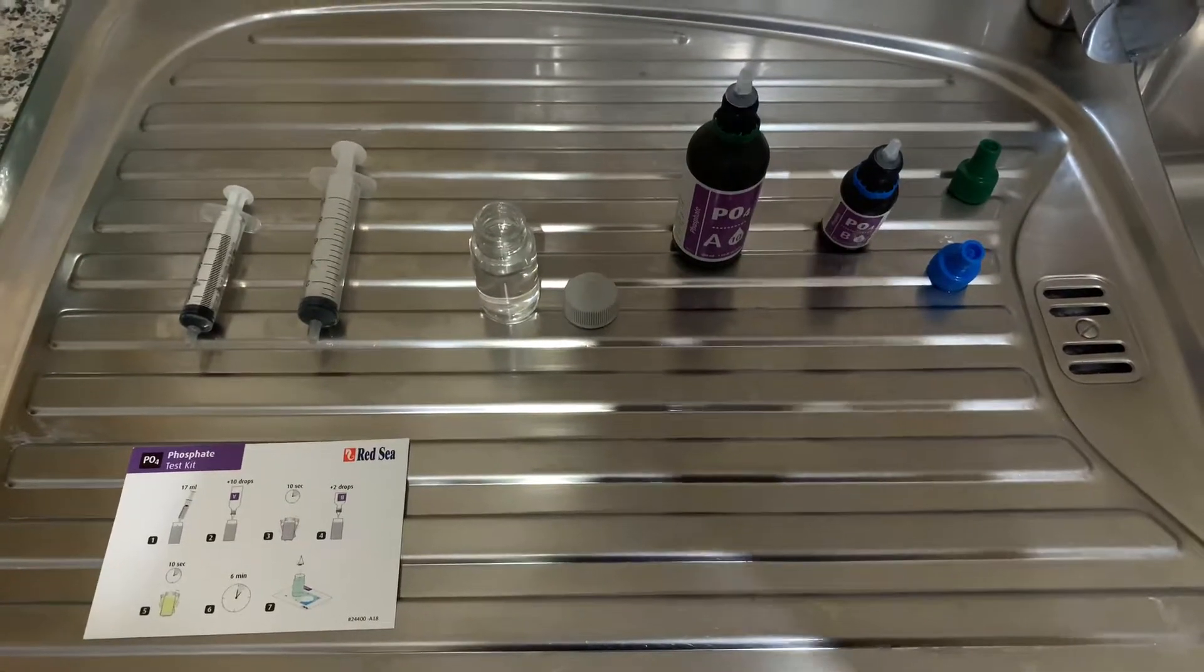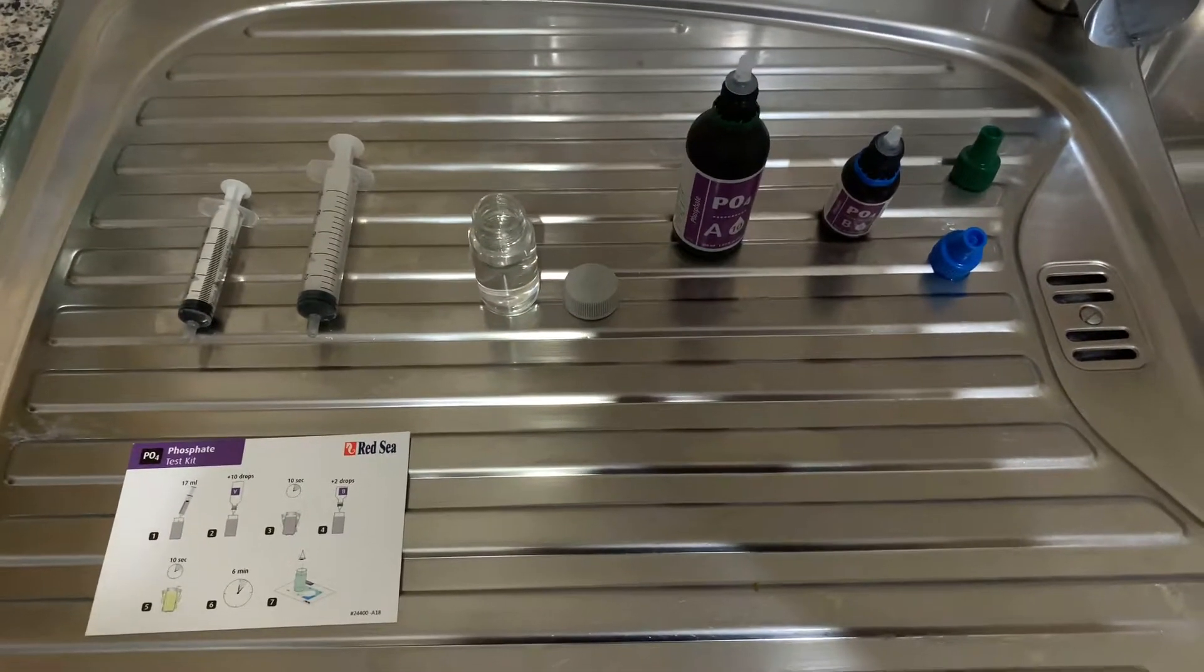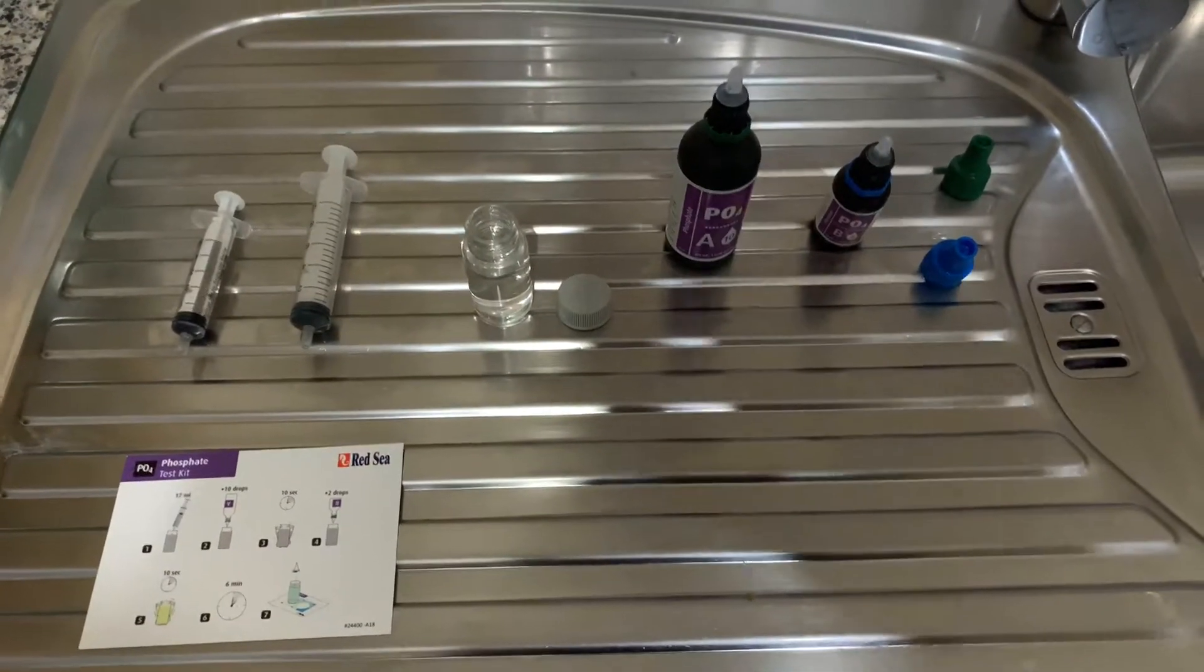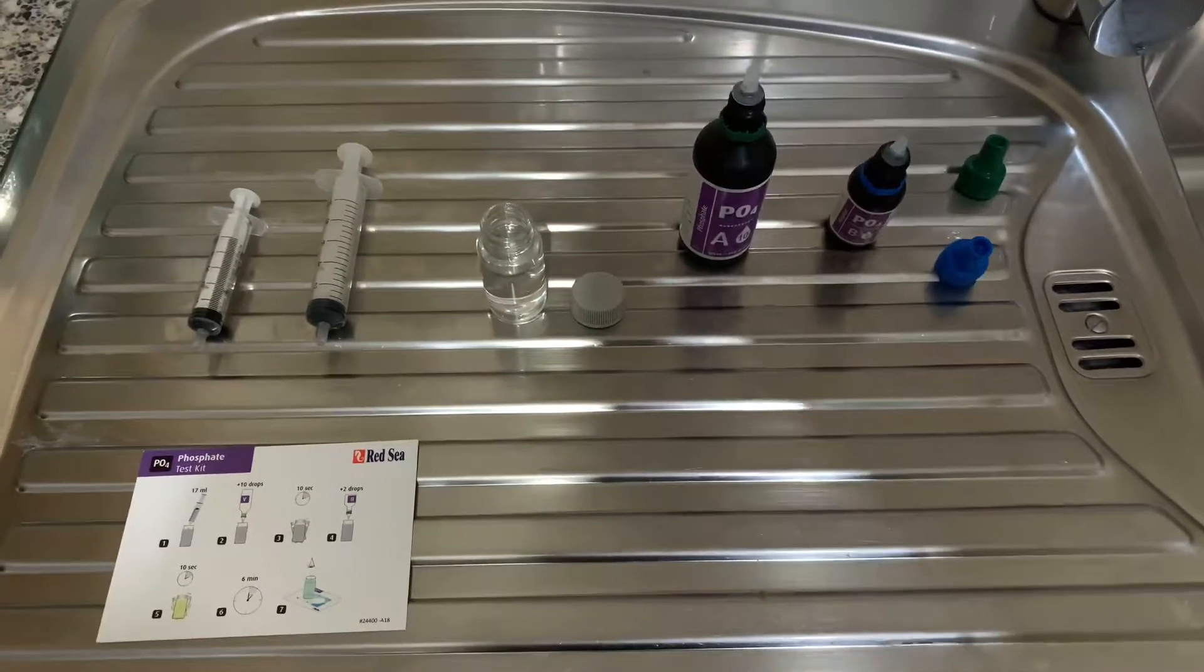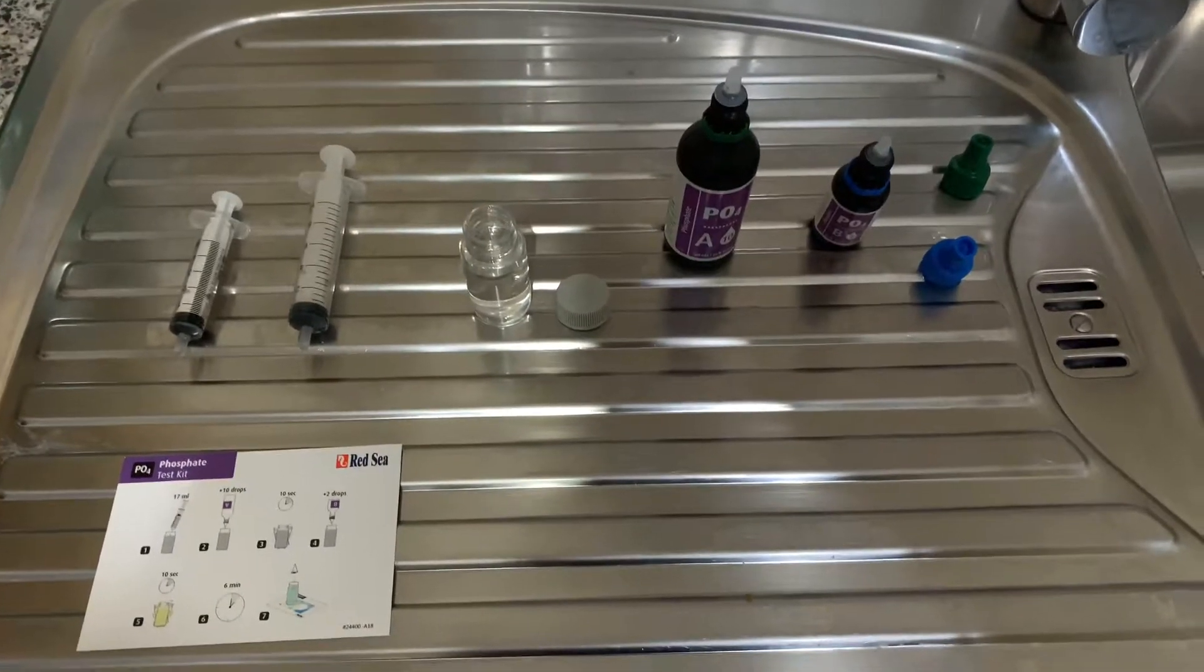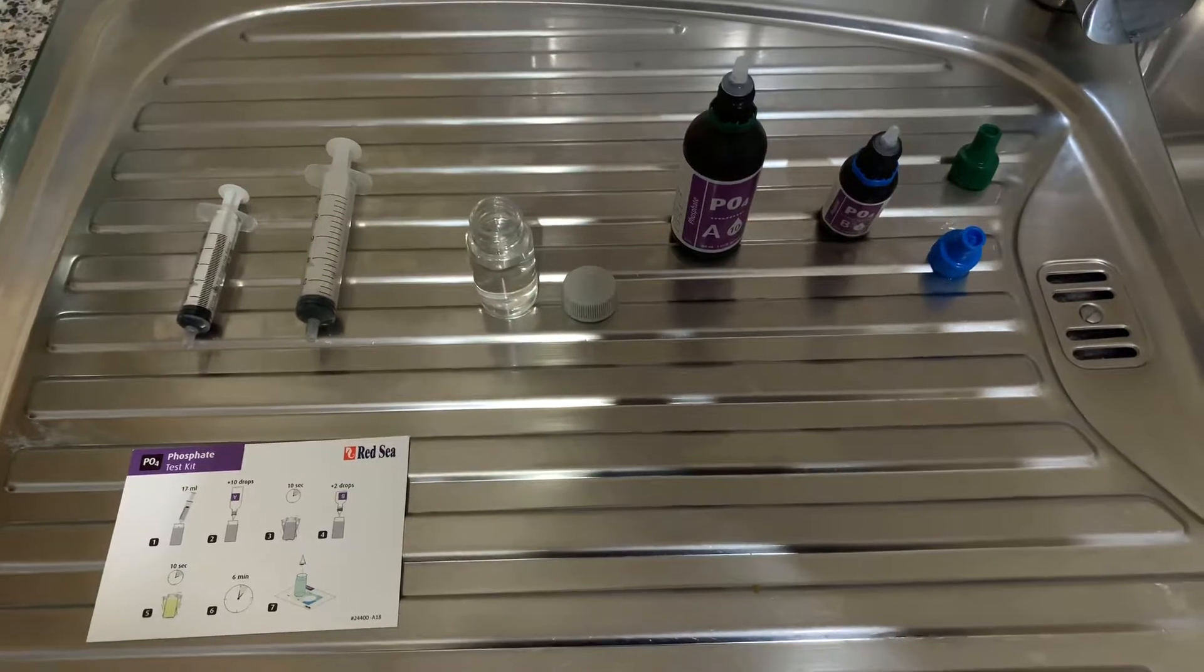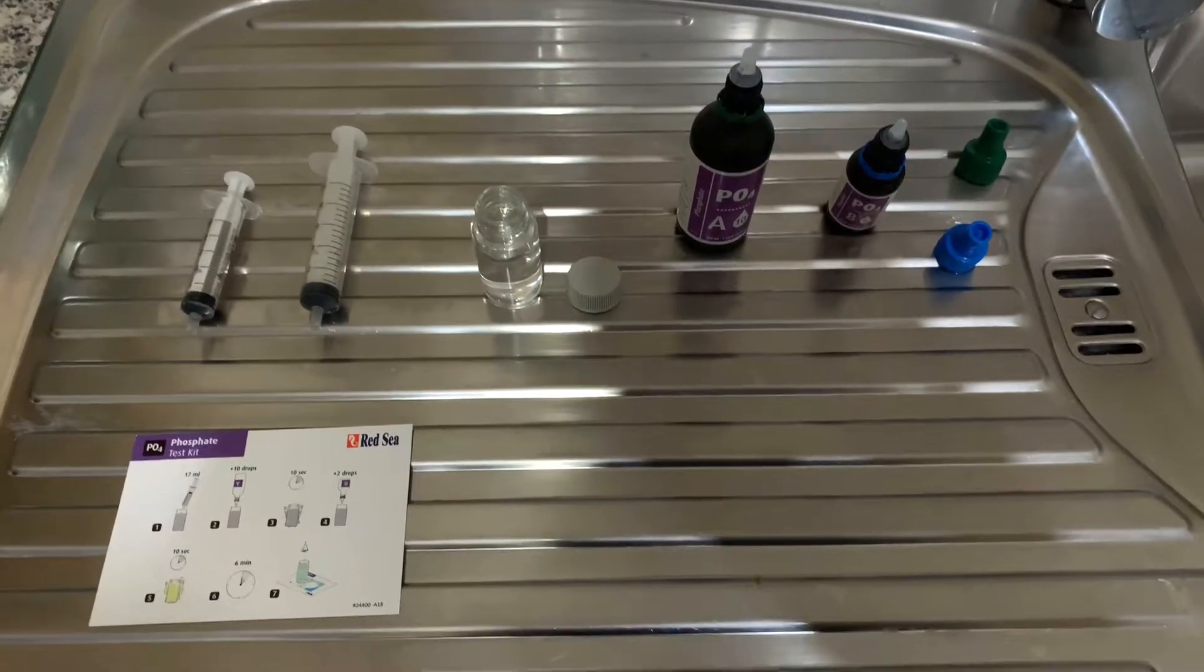It's very important to do this at least once a week because high phosphates create a lot of algae and I've had quite a big problem in my tank with that. I've managed to get my phosphates down but this is how I do it. So here we go.